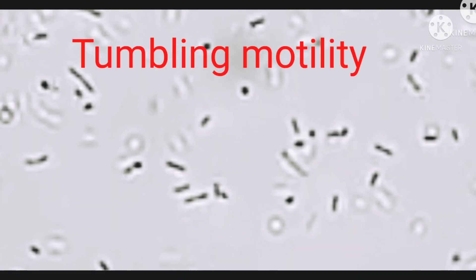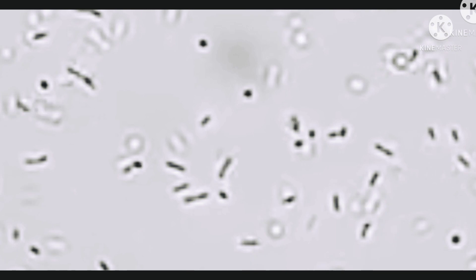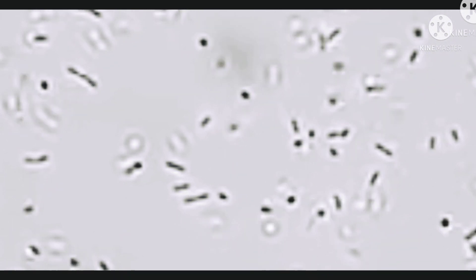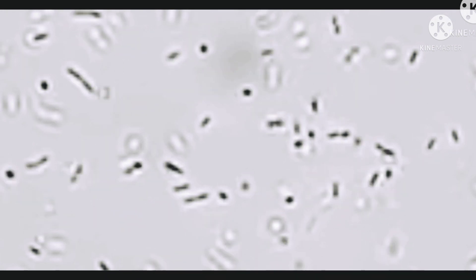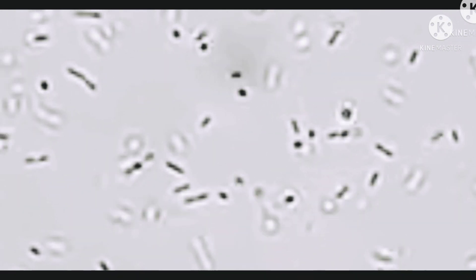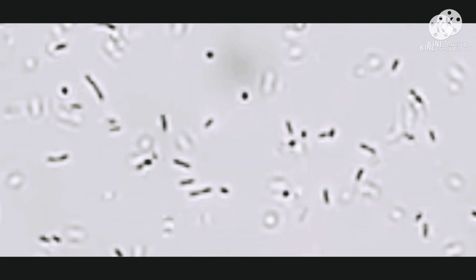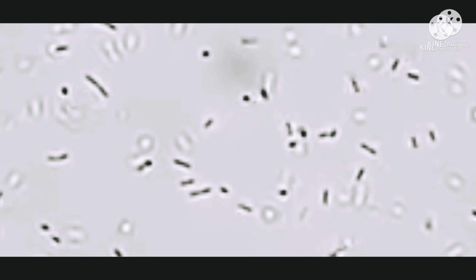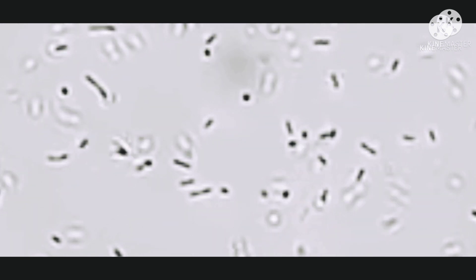Next is tumbling motility, shown by Listeria monocytogenes and Yersinia enterocolitica. Here the flagella develops only at 20 to 28 degrees Celsius, so they are motile only in this temperature range and are non-motile when grown at 37 degrees Celsius. You can see the bacteria tumbling or performing repeated somersaults.